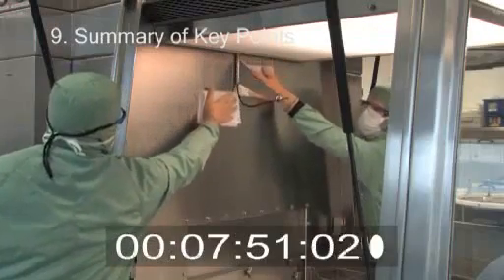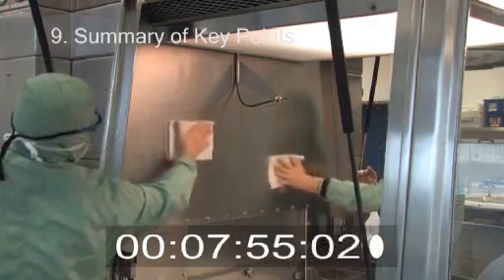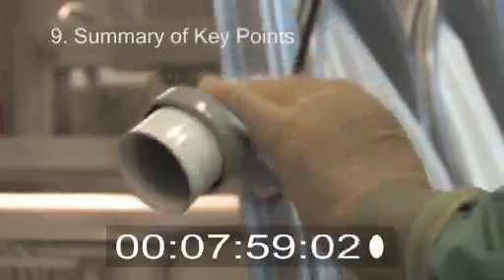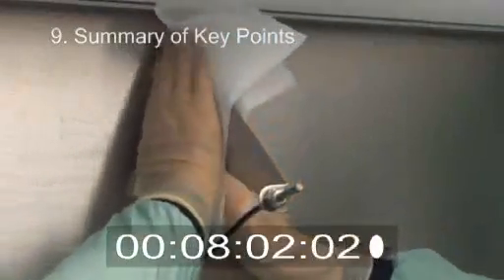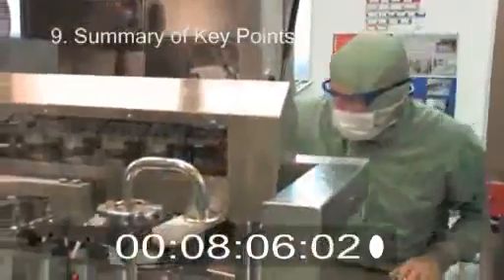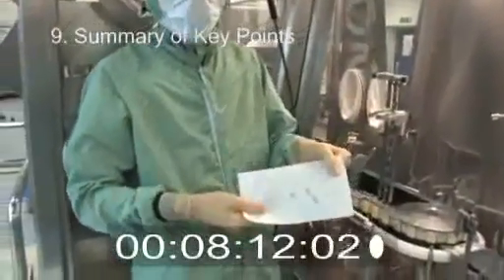Summary of key points. Wiping and cleaning to be continuous, with directional strokes overlapping and mirrored where possible. Clean tools must be used where required. No matter how hard it is to reach or clean certain areas, it is still essential that surfaces are cleaned thoroughly. The isolator must be visibly clean — be mindful of hot spots.